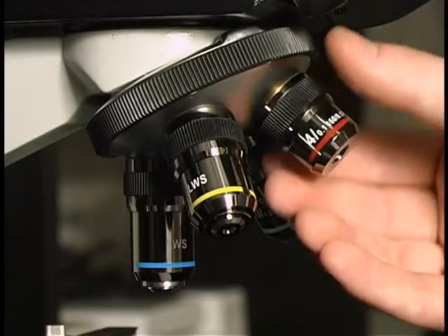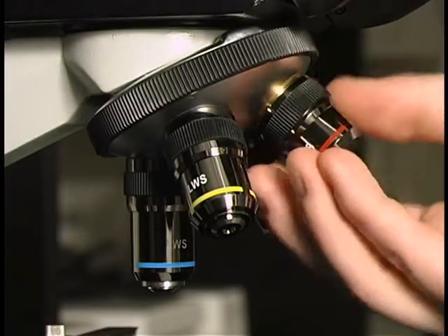Let's look at how to attach the Paralens Advance and its components. To begin, assure that there is an open objective space on the microscope nose piece.